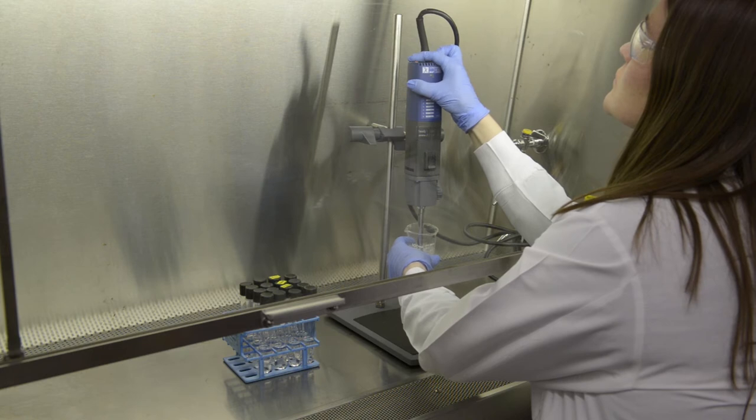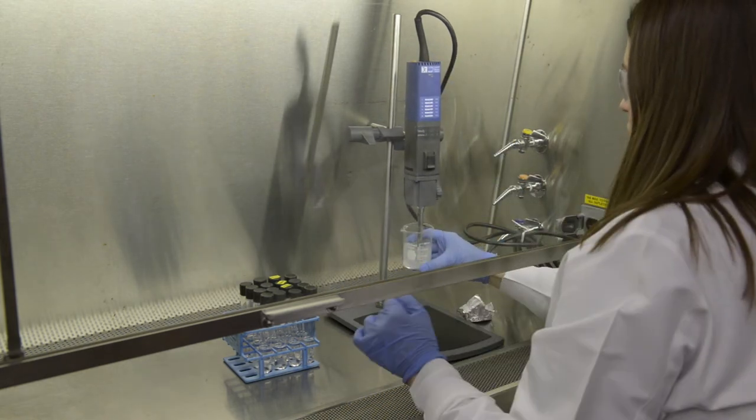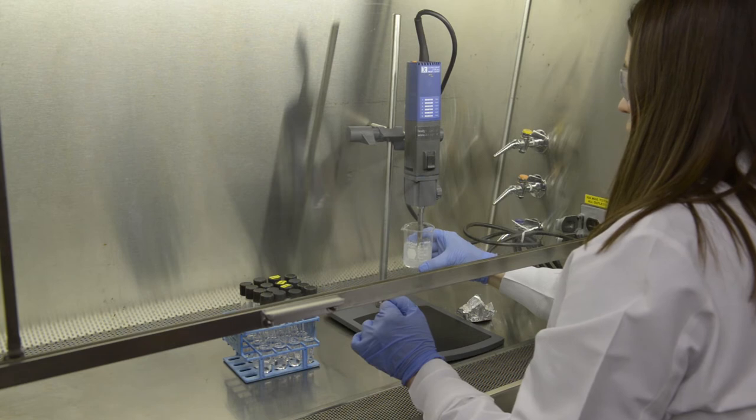Working in a biosafety cabinet, homogenize the biofilm in the beaker for 30 seconds using a sterile homogenization probe.